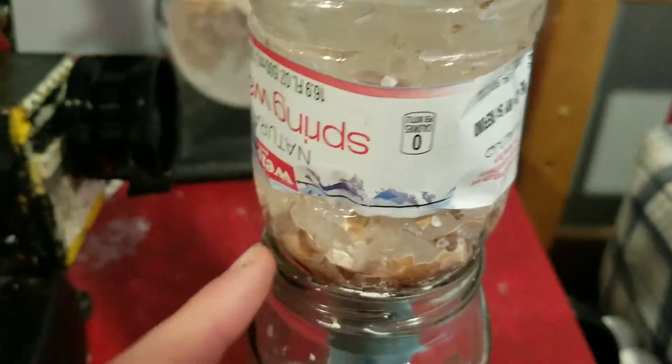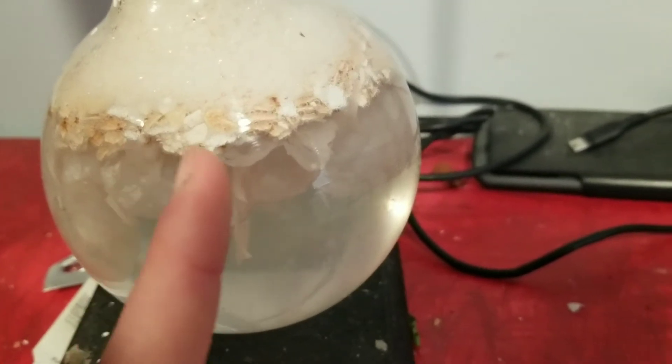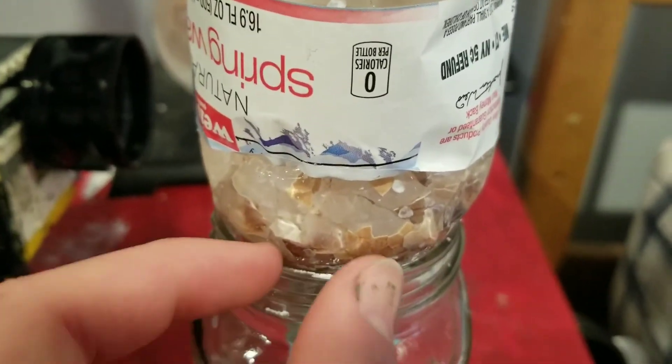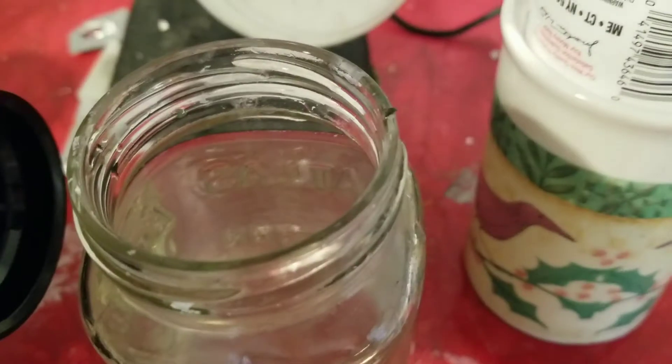The first indicator that the reaction is done is that the eggshells stop floating to the top. I just started this reaction a couple of hours ago and the eggshells keep floating up, but this one has been going on for a day and all the eggshells sink because there's no more carbon dioxide pushing them up. You can also see very few bubbles, and if you smell the solution it barely smells like vinegar. We have enough calcium acetate filtrate to begin the experiment.